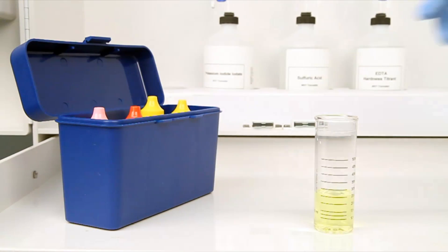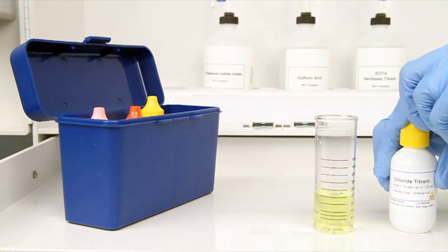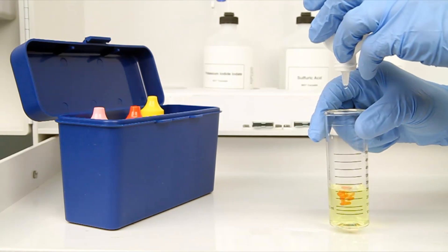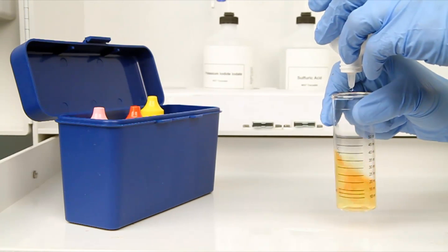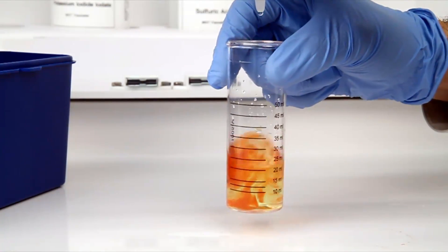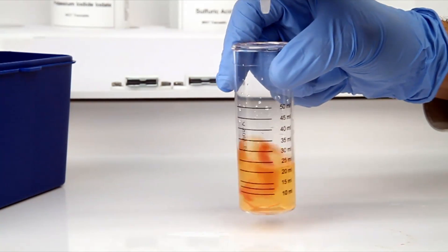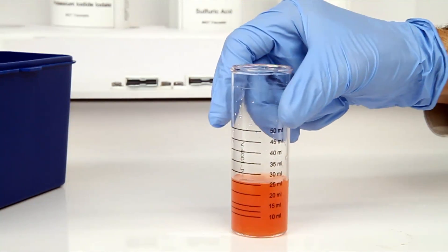The next step according to the Endpoint ID procedure is to perform the titration. Each bottle of titrant is labeled with the equivalency and sample size it was manufactured for. It is important to make sure you have the proper titrant and the proper sample size for this titration. The bottle of titrant contains a dropper tip, therefore it is important to hold the bottle vertically to make sure you get a consistent drop size. After the addition of each drop of titrant, swirl the vial to make sure the sample is properly mixed. According to the Endpoint ID procedure, the titration is complete when the sample changes from yellow to brick red.